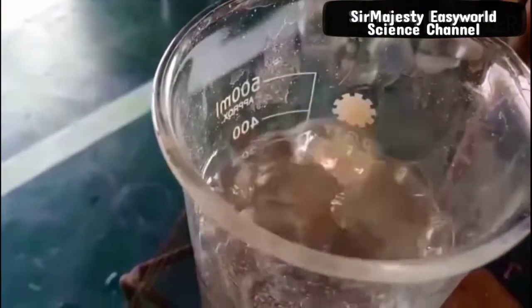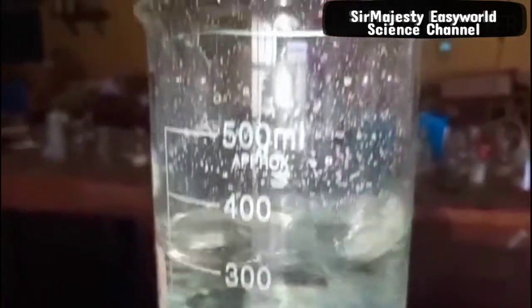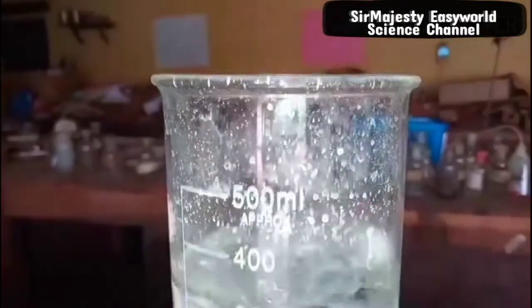On heating it gradually, you see how it behaves in the beginning. This shows that the solution is not yet saturated. We are heading towards 300 ml now. You can see the solution has come down from 400 ml to 300 ml.